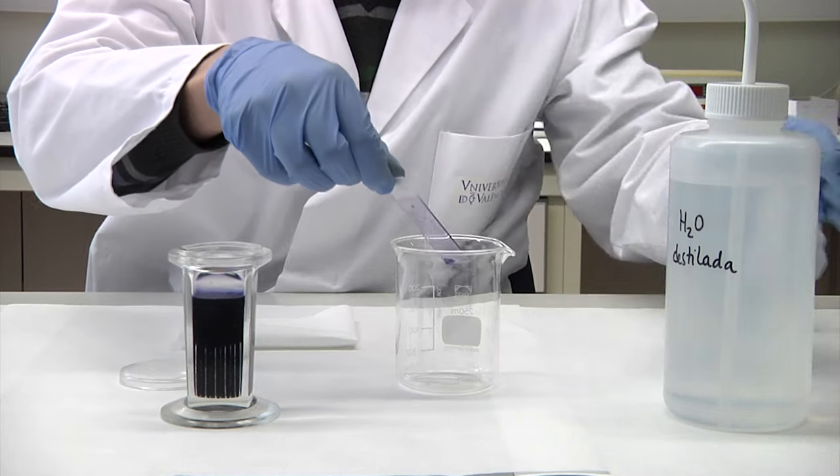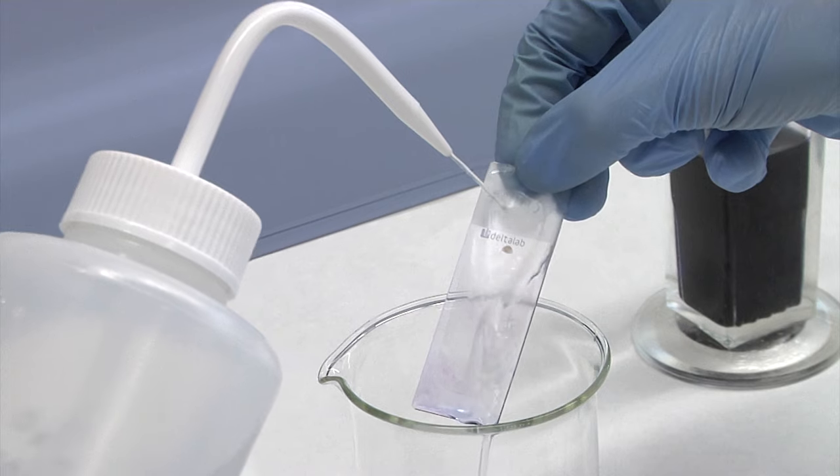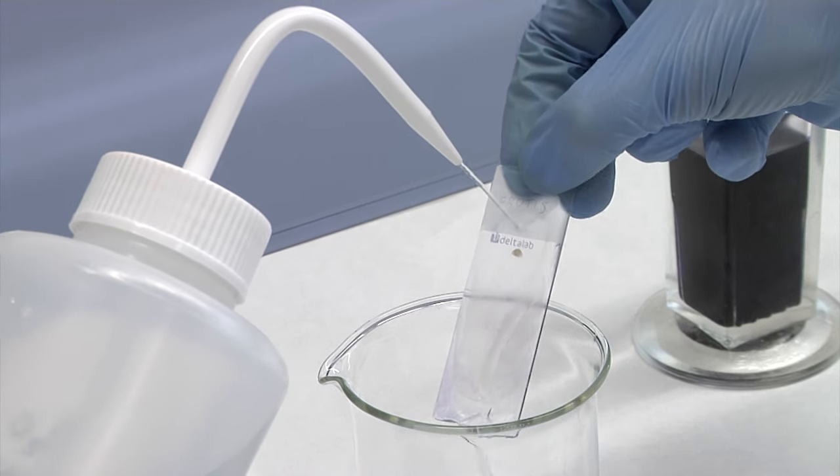Finally, we wash the slides with abundant distilled water. It is important to take care not to throw the water directly onto the sample.